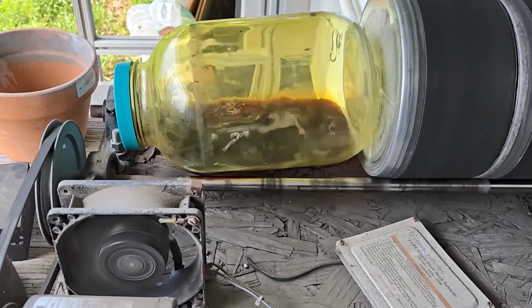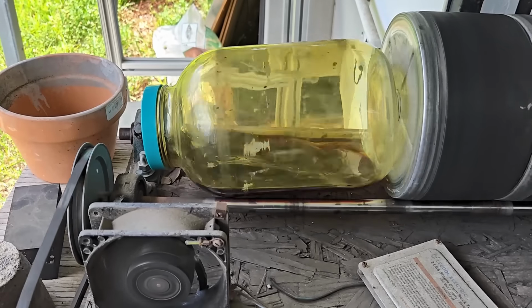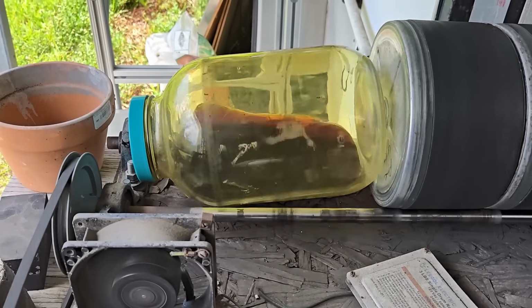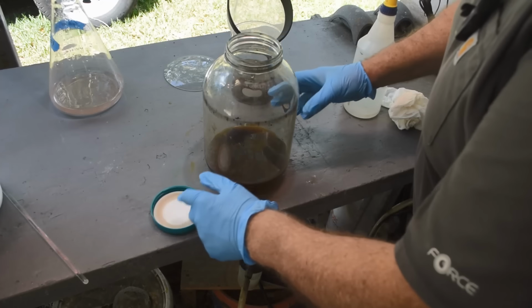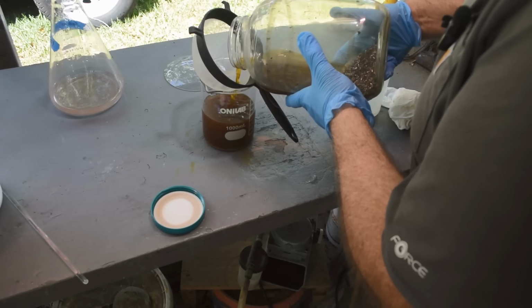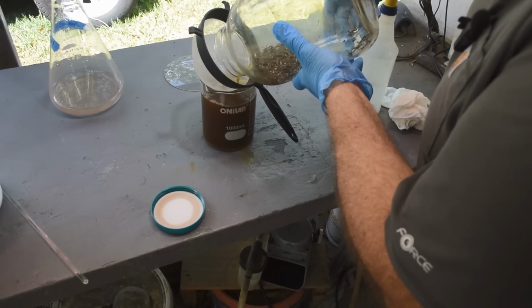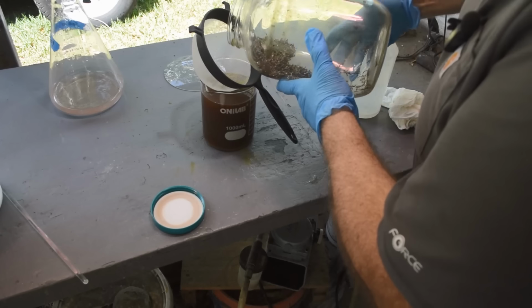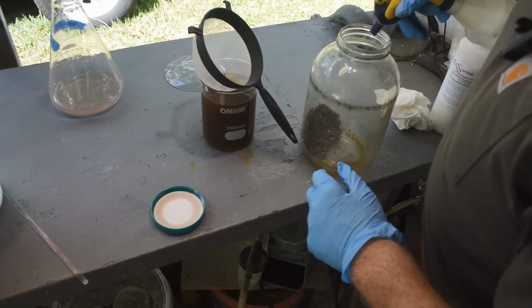And we are off and tumbling for the third and final time. It is 2:43, so I will pull this off at 2:58. And we'll see what the pins look like then. All right, let's pour off this last batch and have a look at the pins. I'm going to give them a little bit of a rinse with some distilled water here. Get the pregnant solution out of it.